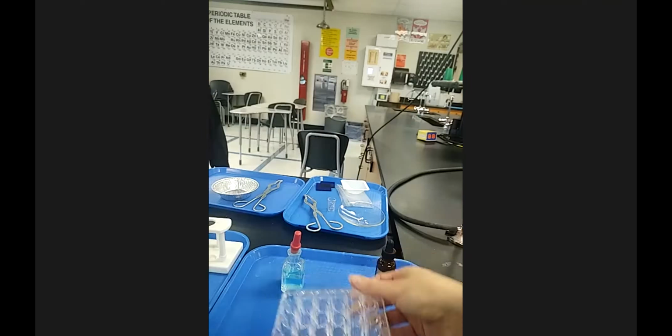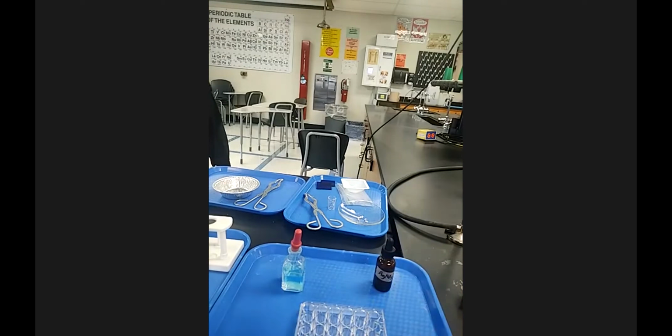And then over here, there we go. That's a good view. That's the silver nitrate and the potassium chromate. Very dark red brown there. From the side, you can see a translucent layer starting to form. And over here, on this one, you can see there's definitely layering occurring. I'll let this sit for a little bit and then come back to it.